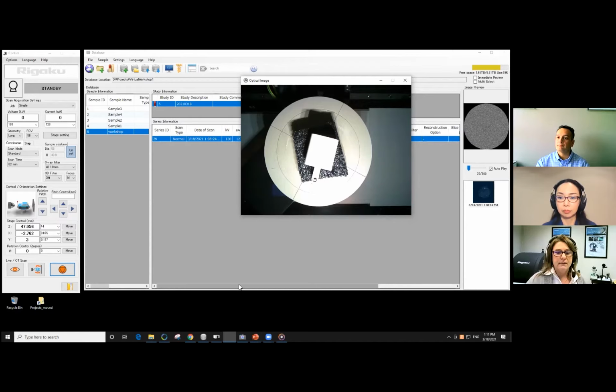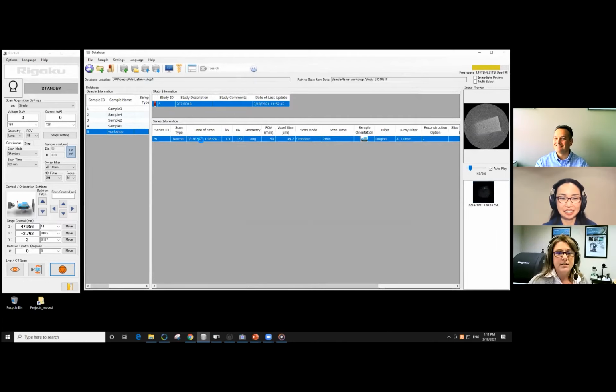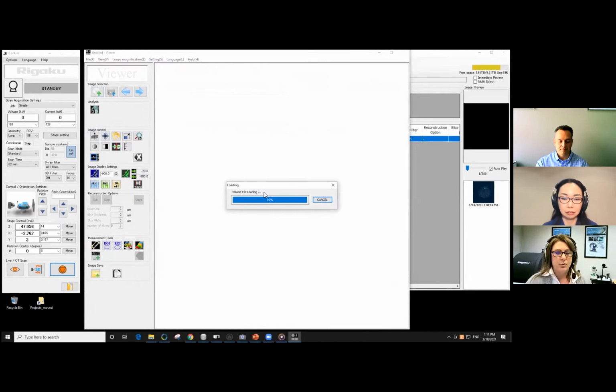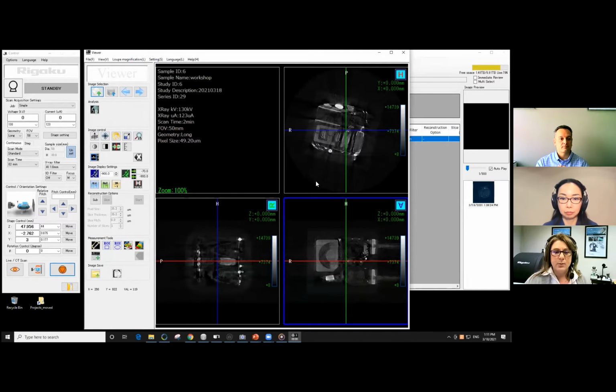My graduate advisor used to tell me, if you put junk in, you get junk out. So you got to consider all the settings that you're using. All right, so it's finished reconstructing. And I know that because this window in the bottom left-hand corner is closed. And here we go. This is our reconstructed view.